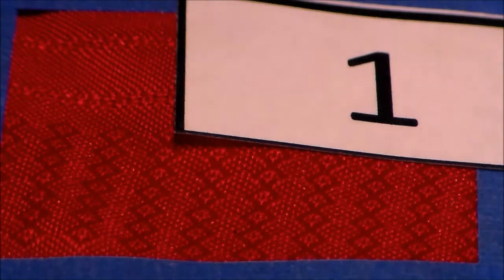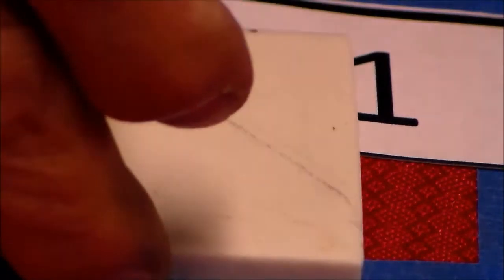Now what we're going to do is start using some of the other mineral properties to help us identify which one is which. So on your mineral data collection table, sample number 1 says that it has a streak that is greenish black. So we're going to need to use our streak plate, and we're going to streak each one of the metallic minerals across the plate.